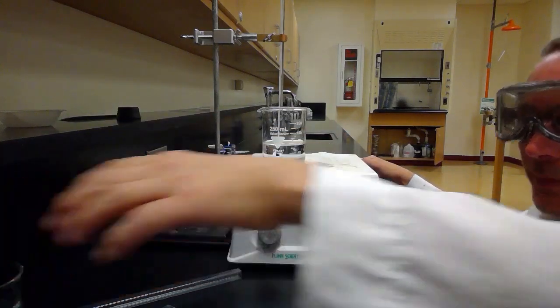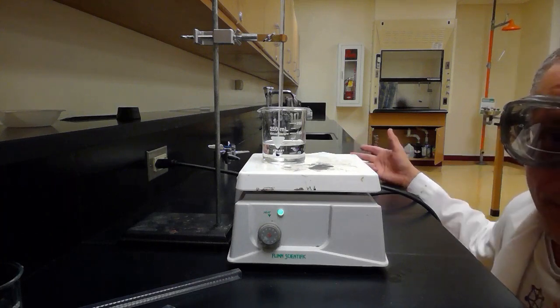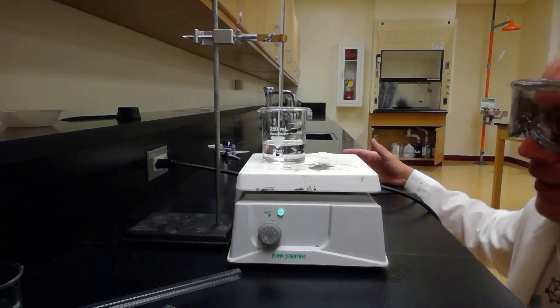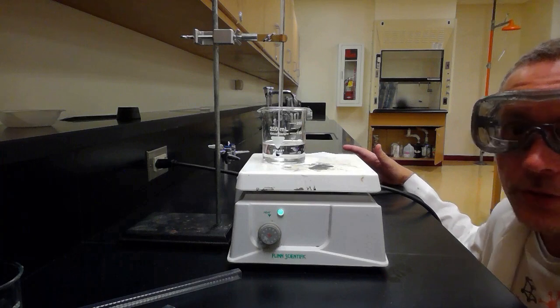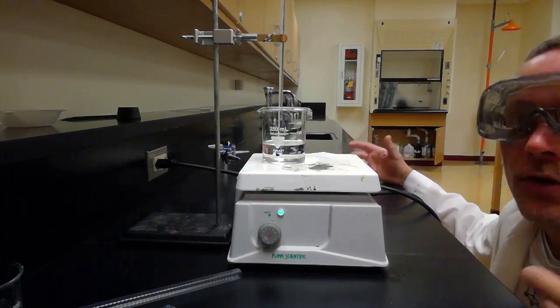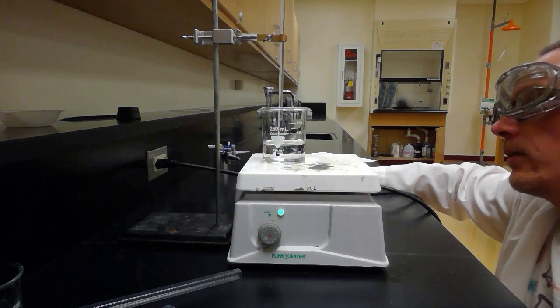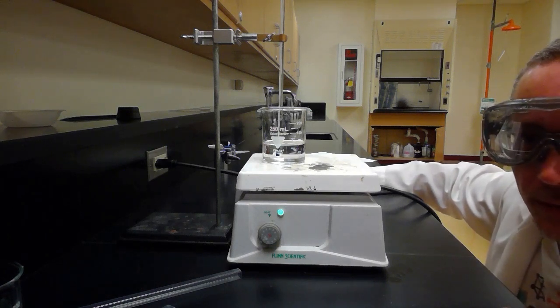The exact amount shouldn't really make a difference here. In fact, it shouldn't make any difference at all, but let's control for it as much as we can, right? So we'll control the amount of water, and we'll control the temperature of the water by having about the same for both. So let's give this a few minutes to heat up. Right now it is about 23 degrees Celsius, so we'll come back in a minute.